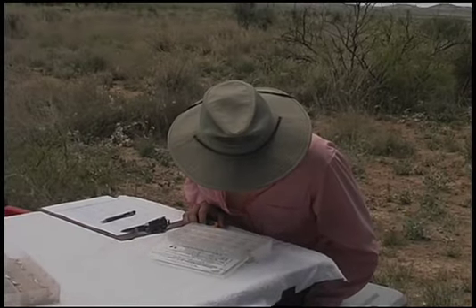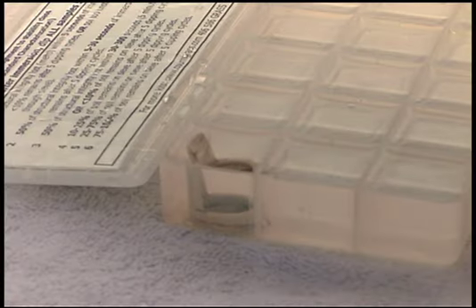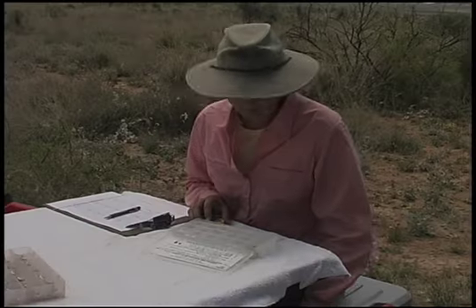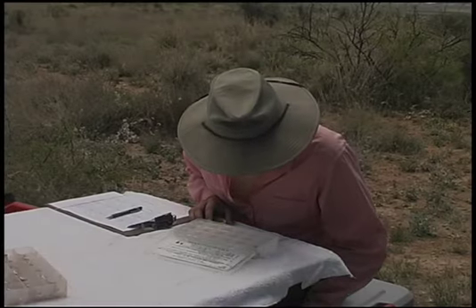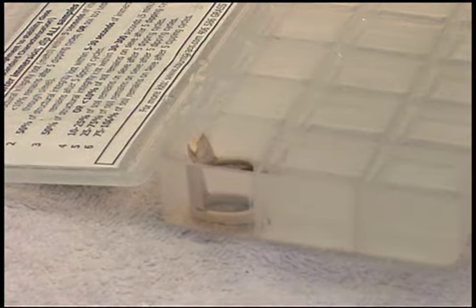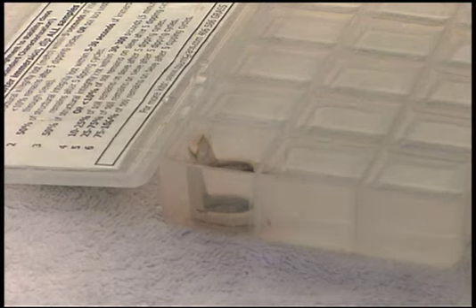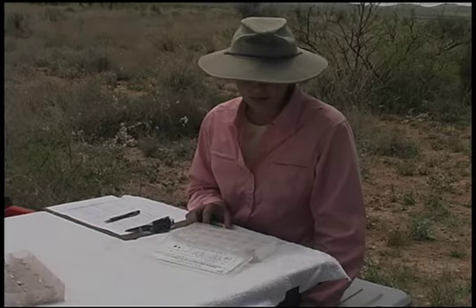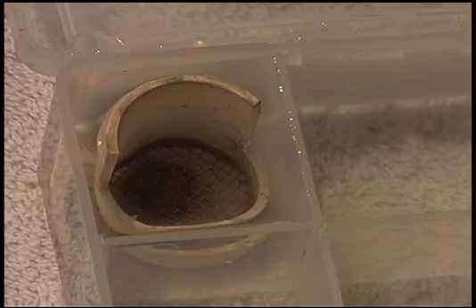Watch the sample for the first 5 seconds. If 50% of the structural integrity is lost, it is rated as a 1. Continue to watch the sample from 5 until 30 seconds. If 50% of the structural integrity is lost between this time, the rating would be a 2. The stability class will be rated as a 3 if 50% of the structural integrity is lost between 30 and 300 seconds or 5 minutes.